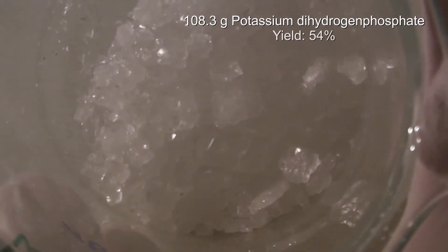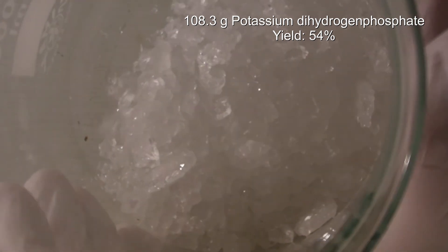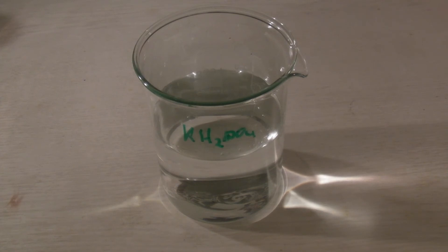But by boiling down the solution, the yield could also be quantitative. I decided to use the solution for growing larger crystals.